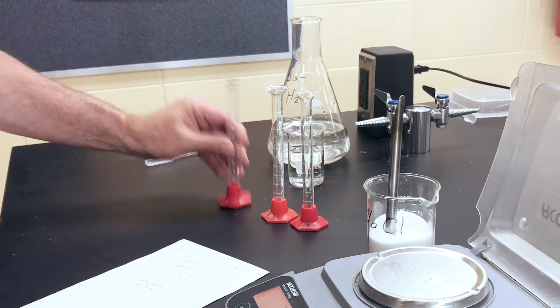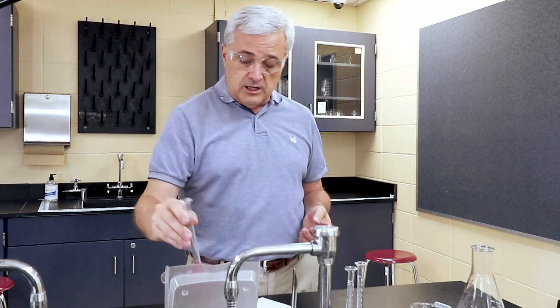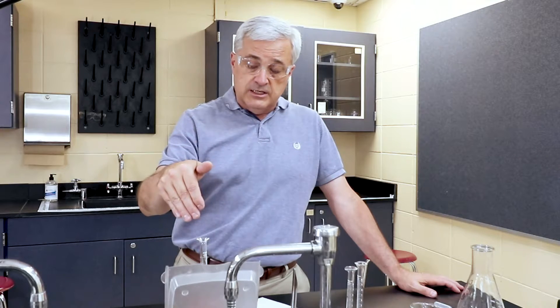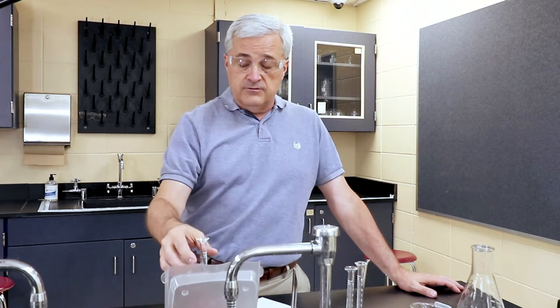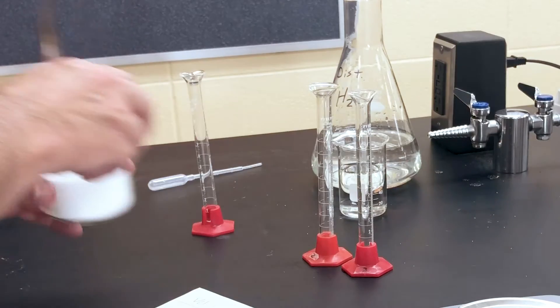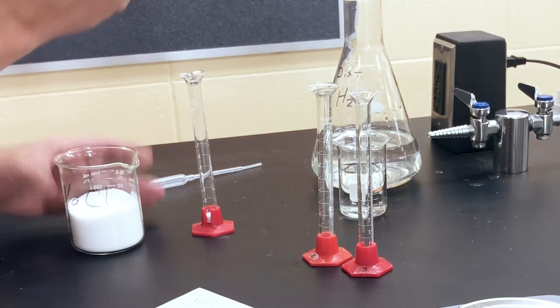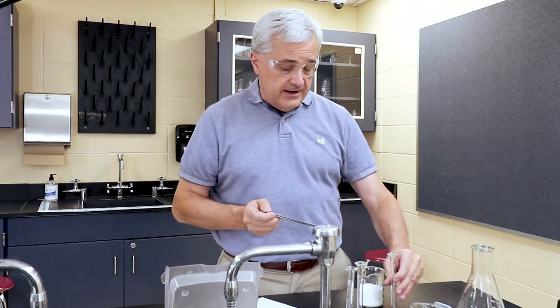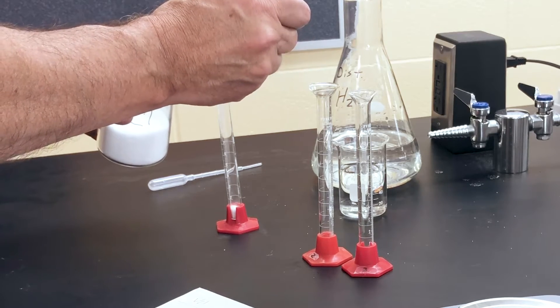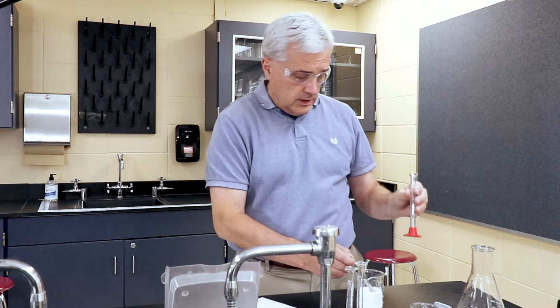So we're going to start with graduated cylinder number one, and into it we're going to place one milliliter of salt. But first we're going to zero the scale, and then we've zeroed the scale. So when we put the salt in here, we'll be able to find the mass of the salt. So we're going to use the spatula to try to bring the salt level up to approximately one, really close to one.